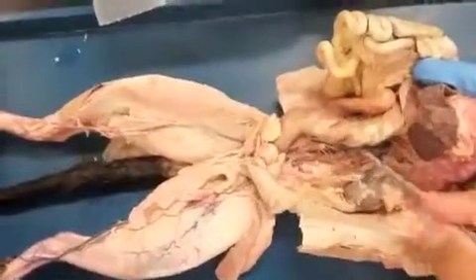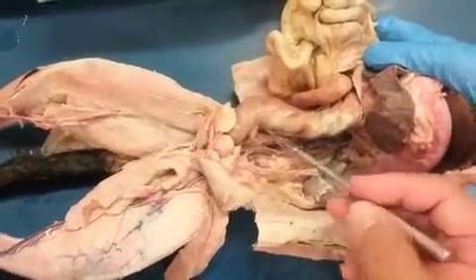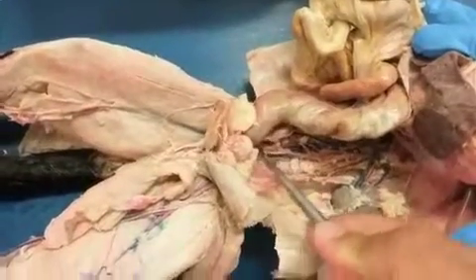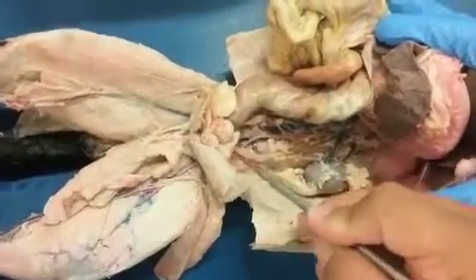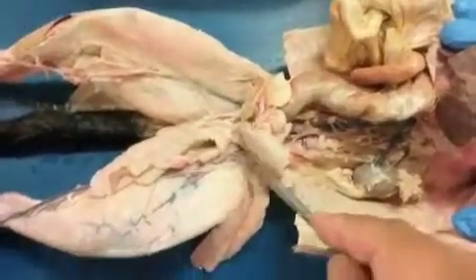And then finally, the last major branch that you're going to see here, as we lift the colon, you'll notice the inferior mesenteric. Right? Inferior mesenteric, coming off of the abdominal aorta, supplying the colon. And then from there, you have the deep. You're going to have to maybe do some cleaning here if you can. But here, the abdominal aorta would split into external and internal iliac arteries. Right? The more superficial ones are going to be the external, like the one you could see there. Right? If we follow that external iliac artery out, eventually that gives rise to the femoral artery.